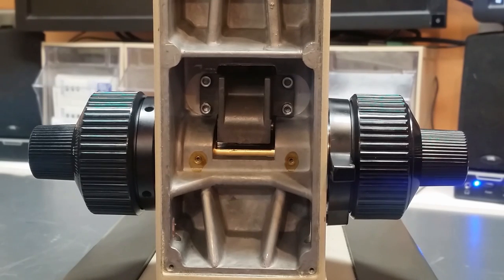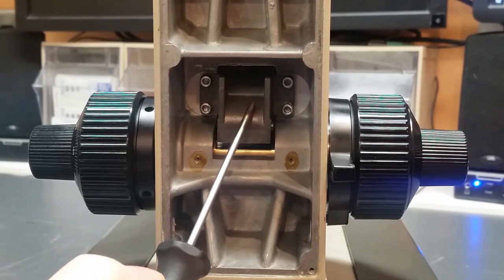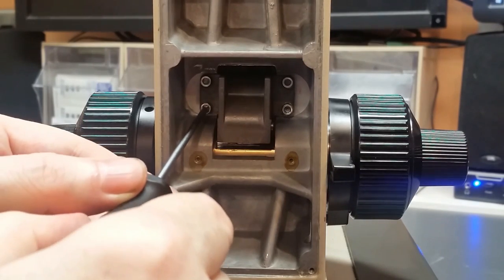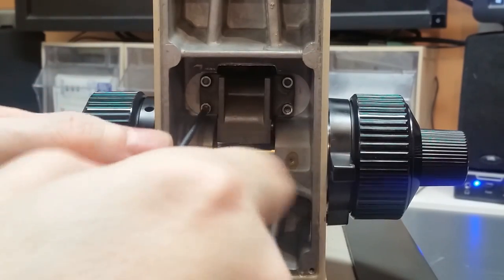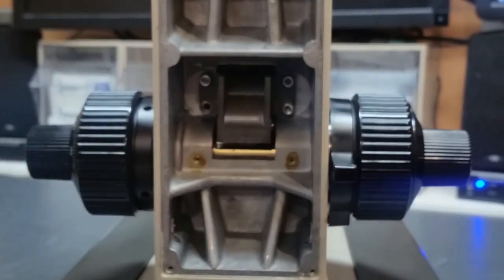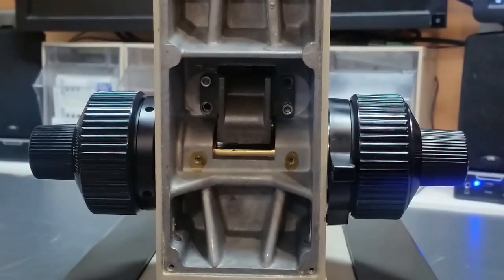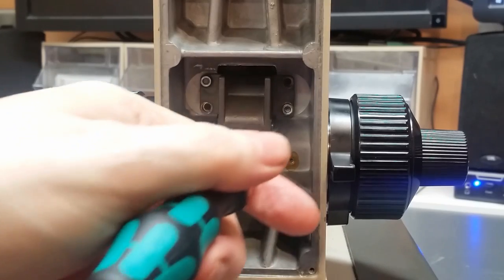Okay, step two is the removal of this gearbox assembly. It's held in place with four metric hex socket head cap screws. And I'm going to start out by just removing two of the screws on opposite corners without touching the other two at this point. There's one. Now on the opposite corner here, I'll take out the second one. Okay, now at this point the gearbox is held in place by these two remaining screws.